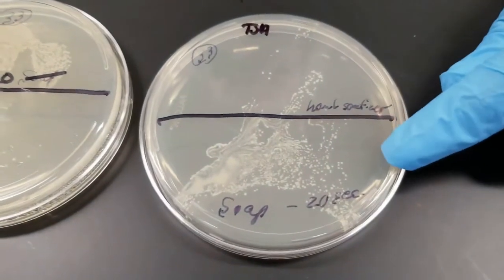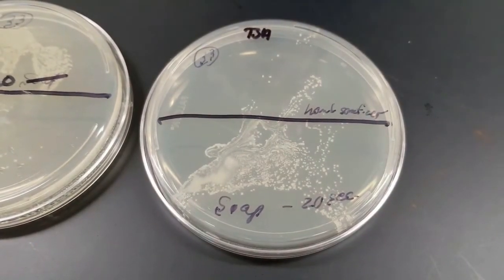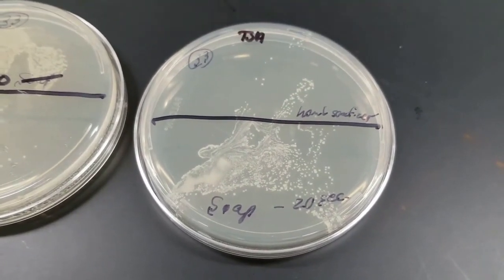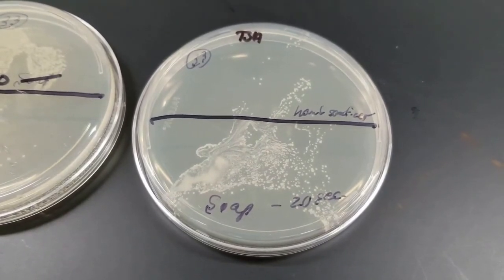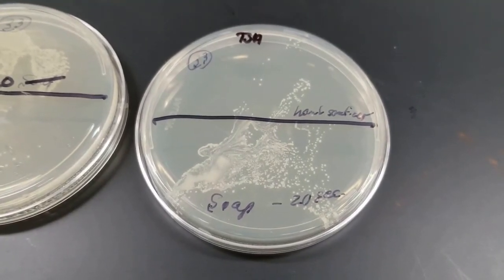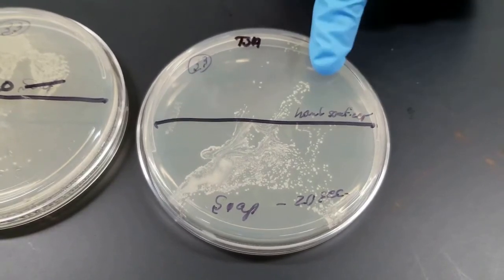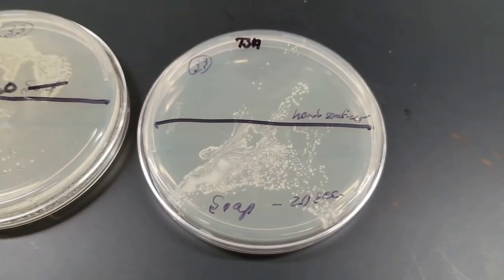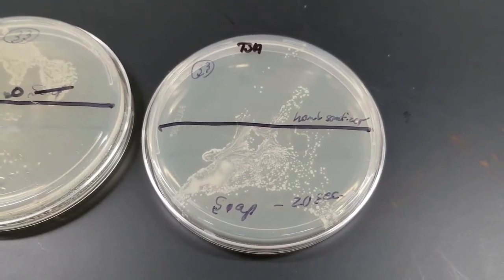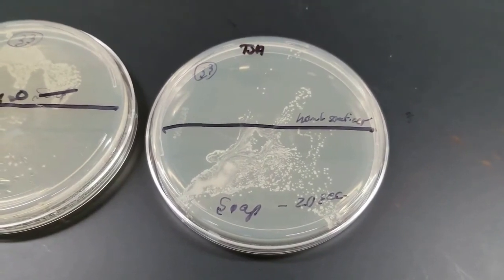Over on this plate now at the bottom, this is where I washed my hands. I used just regular soap, and I did wash it for 20 seconds, which is the recommended time period. Now, excuse me, once again, I'm touching the water faucet, I'm touching the soap dispenser, and then in between, I'd also use paper towels, touch the paper towel dispenser. So that might be where some of the bacteria is also coming from. And then this upper quadrant here is when you used hand sanitizer. Once again, how many people have touched the top of the hand sanitizer? Just some of the things to keep in mind, be aware of cross-contamination.